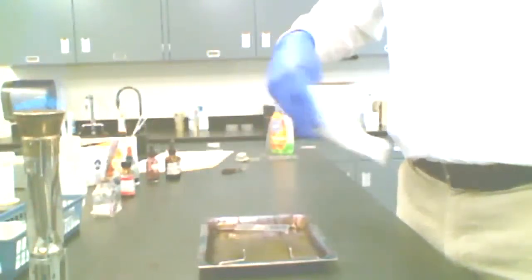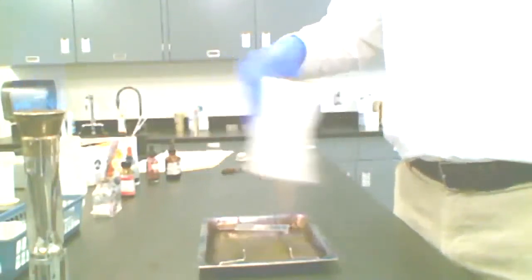And I had a pretty small water drop. It still probably was more than I needed. Once it does dry, we'll show you the dried emulsion on the slide, so you can see what you would want to see. After it's dried, we call that a smear. A lot of times you'll make a smear and you really won't see much. It's really tough to see.